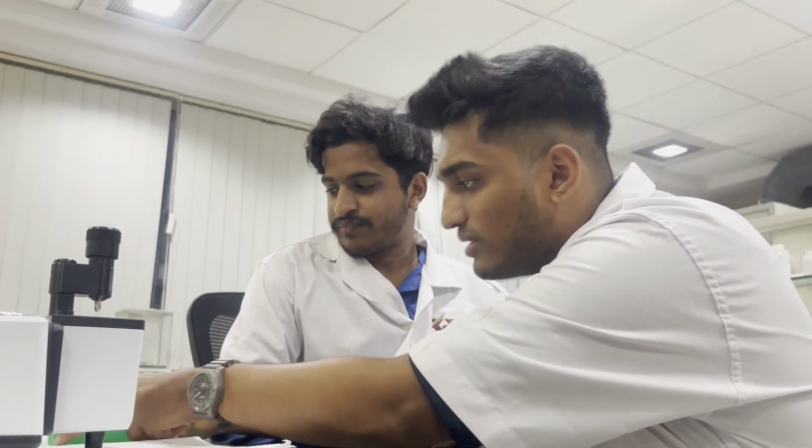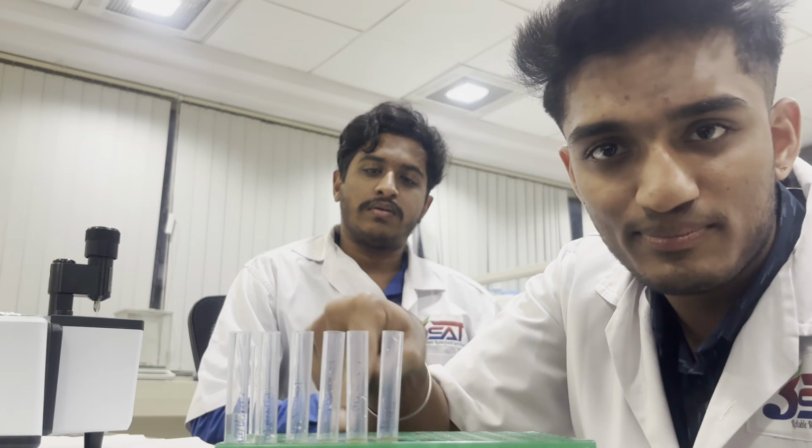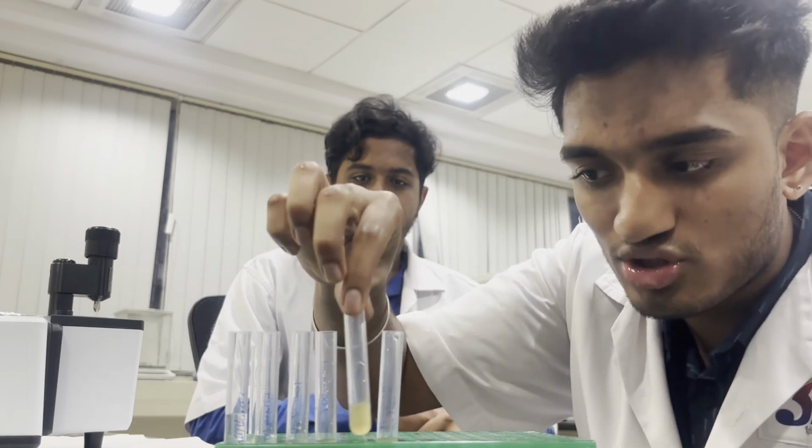So today, let's get back to the video now. What we're going to do is build a model. Why did I take this? Because these are the samples, these are the standards. Sugar solutions of varying concentrations will be read by the FTIR, and we will make a model out of that, and the model will have a calibration curve.